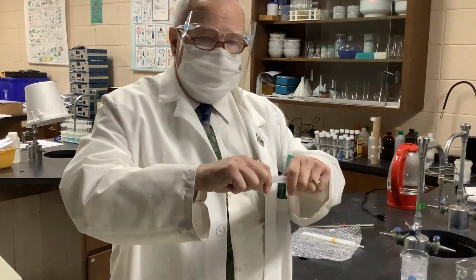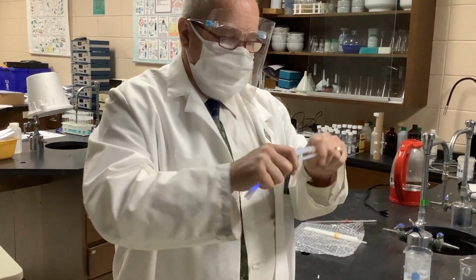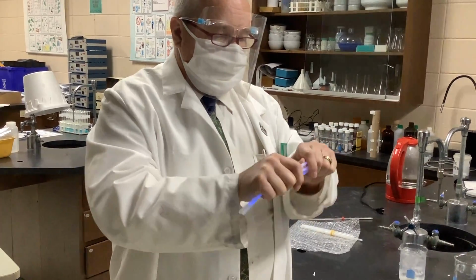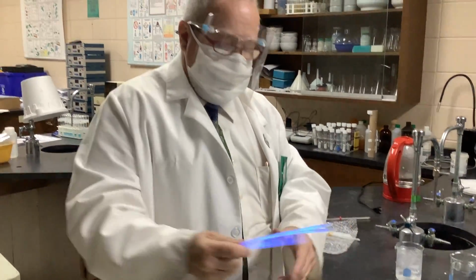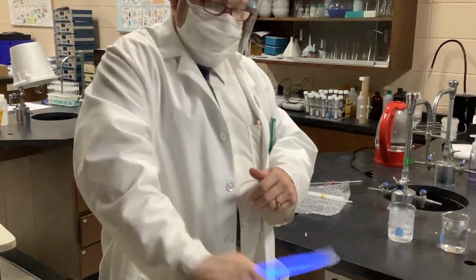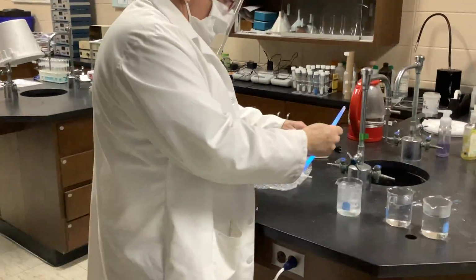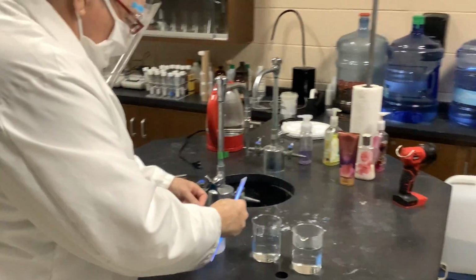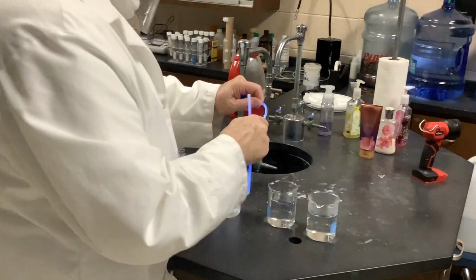They're kind of bluish, purplish. I'm going to mix them up the best that I can, and set them in the different temperatures of water, and we're going to keep filming here.